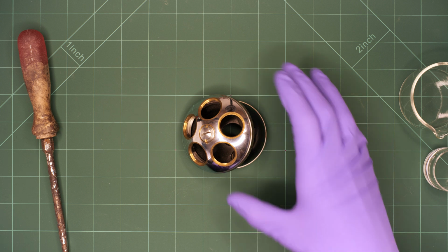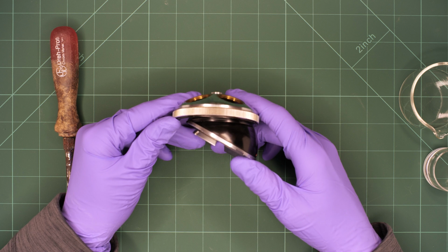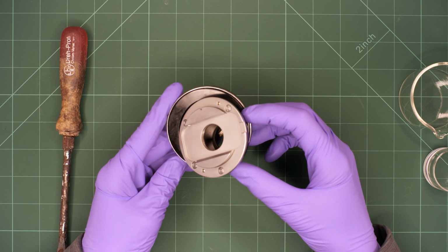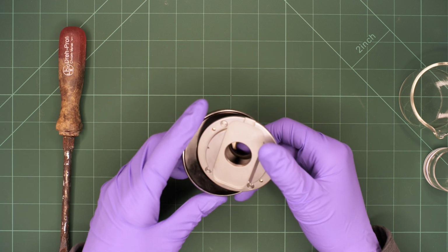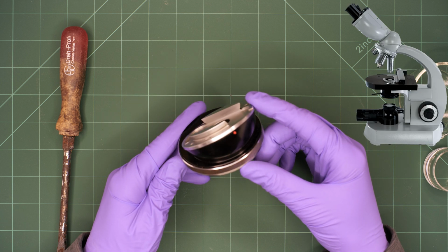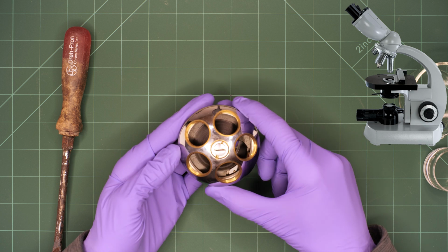I will be showing you how to maintain a Zeiss Standard microscope nosepiece in case yours is difficult to operate due to old hardened grease. This particular nosepiece is from a Zeiss Standard Photomicroscope I, but the procedure is very similar for most of these Zeiss microscopes. Most likely you will have a microscope that is similar to the one in the picture.